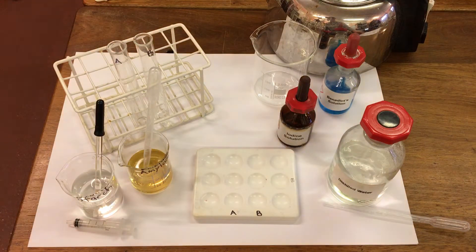To test tube A, I'm going to add 1 ml of our enzyme amylase.